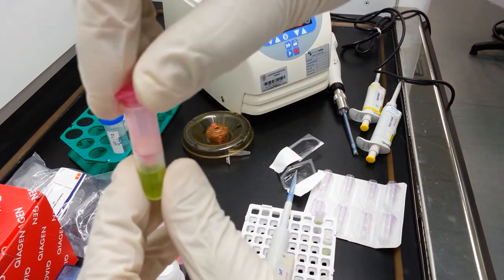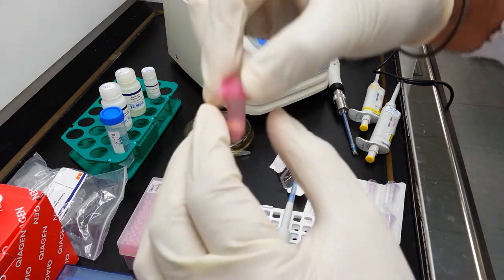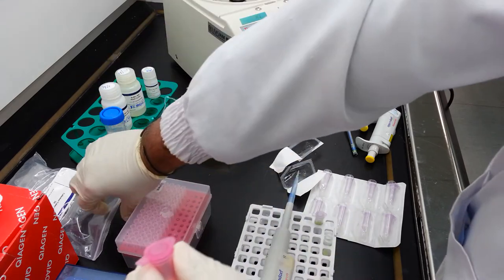The lower collection tube may now be discarded and the upper tube has to be transferred to a fresh collection tube.